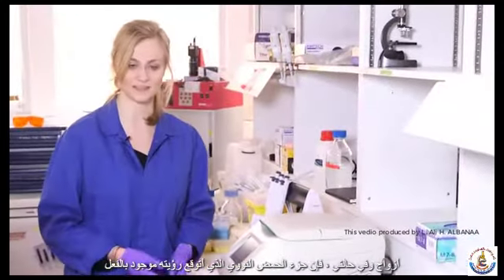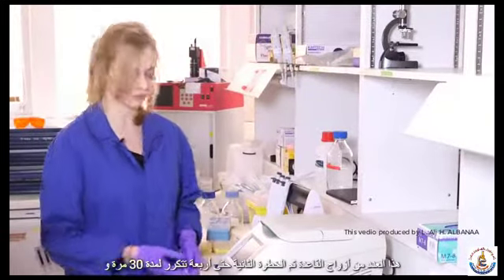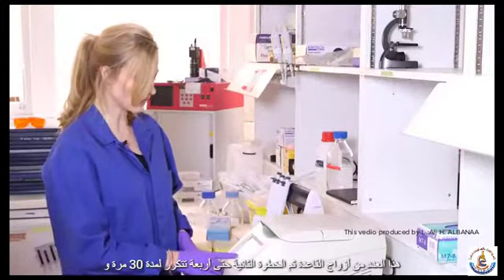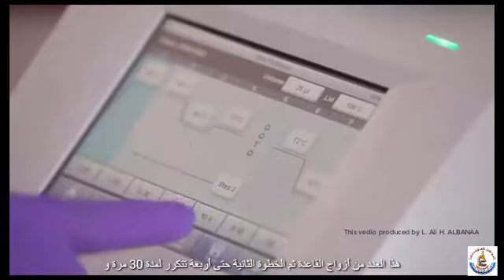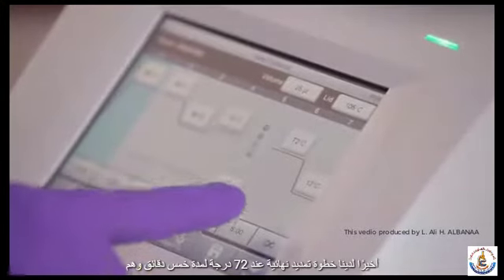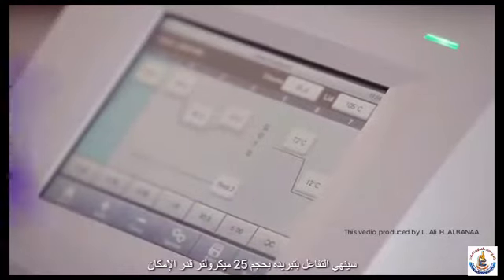And in my case, the DNA fragment that I expect to see is indeed around this number of base pairs. Then steps 2 until 4 are repeated 30 times. And finally, we have a final extension step at 72 degrees for 5 minutes. And then we'll end the reaction by cooling it down.